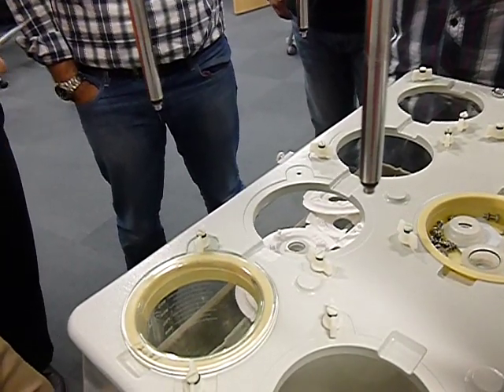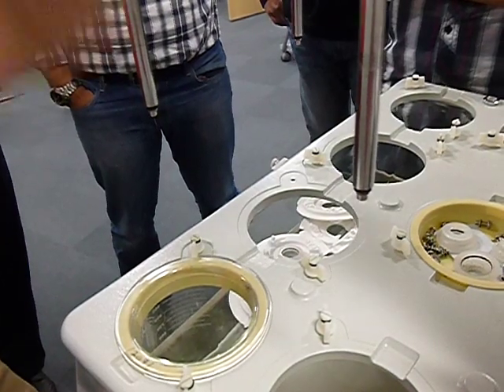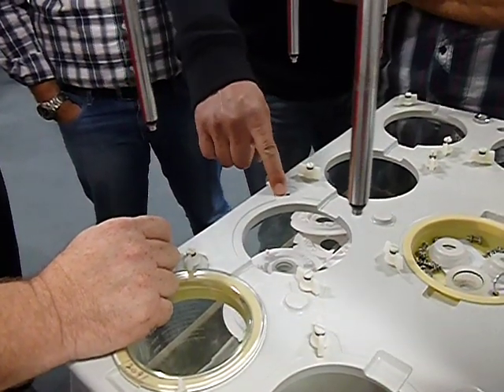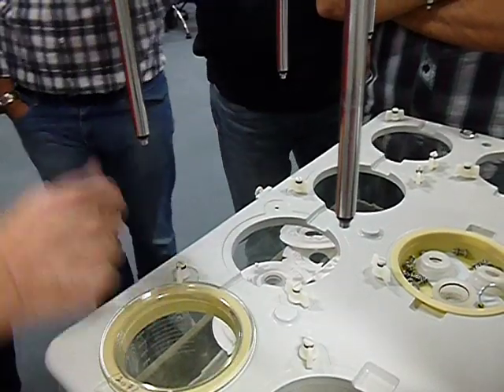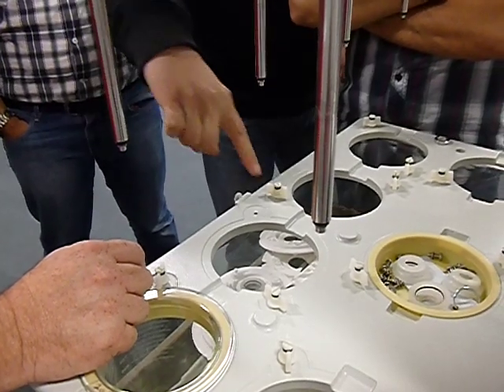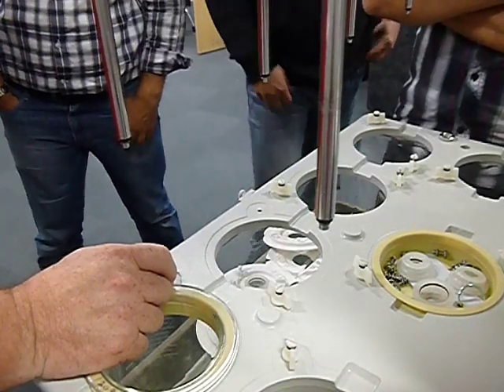And then I see people put plumber's tape on there in order to keep it in place. If you really want to make sure you don't damage the threads inside there, get a pick and just keep picking. It'll take you 5 or 10 minutes. If it's damaged, you drill a bit more, and then get a bigger screw? Not a bigger screw, it's like a spring, like a wire, and then you put it in. Yeah, you can do that. And you have a smaller diameter. True, you could do that too.